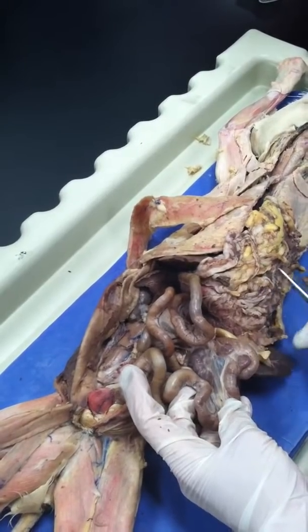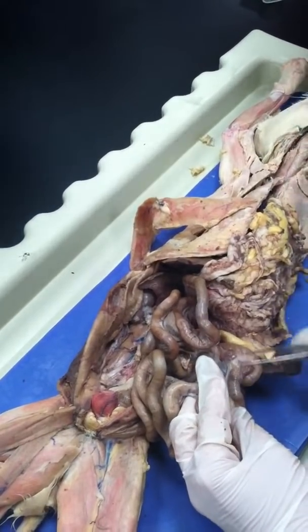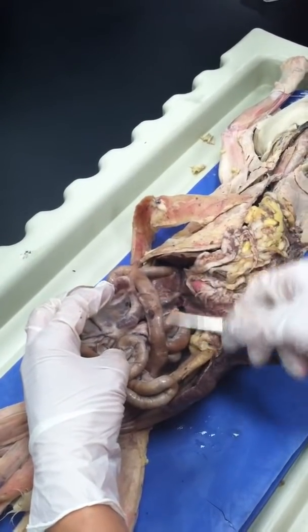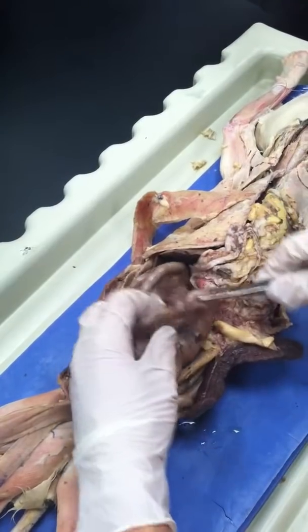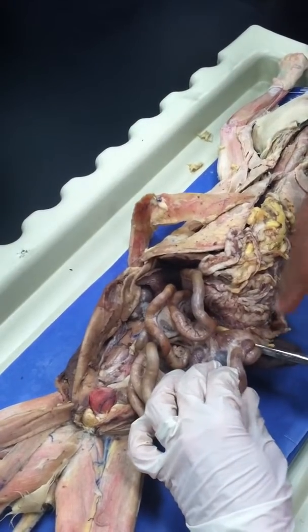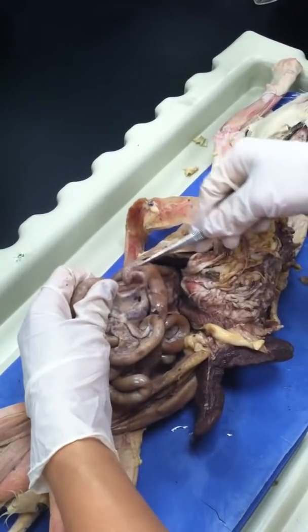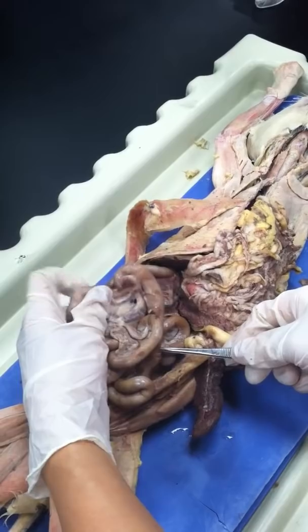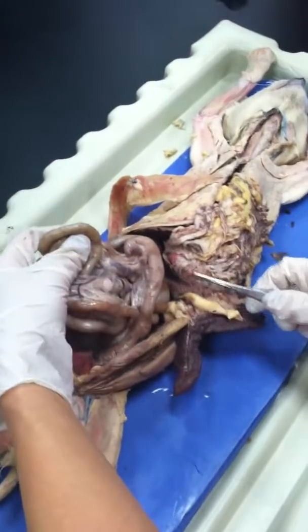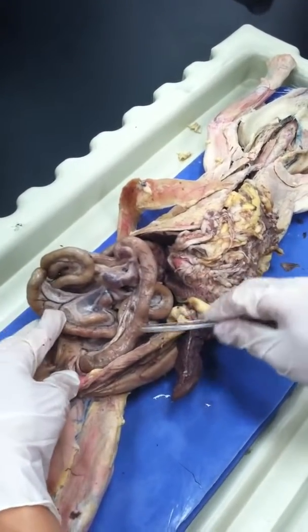Above the cecum, just an inch above it. Where is the large intestine? Show me the large intestine. Okay, this one. This is transverse, and before the descending, the transverse should be the ascending, a small piece. If this is the cecum, make 1 inch ascending and then the transverse follows. So 1 inch ascending, then transverse, and then you have your descending. It's not as classic as in the human being. So you have all parts of the large intestine this way, and then the end is the rectum and anal canal.